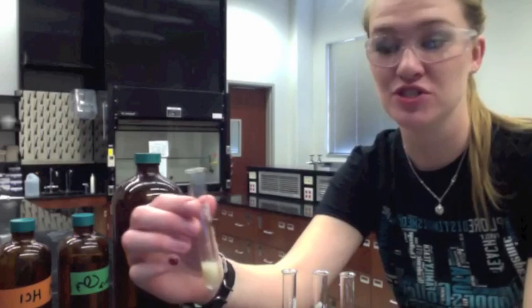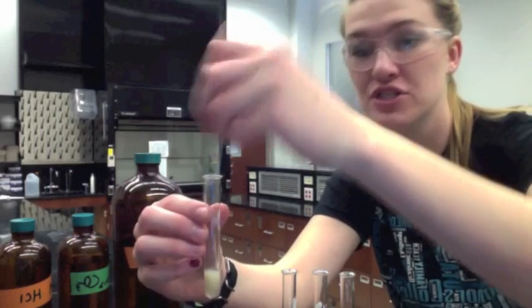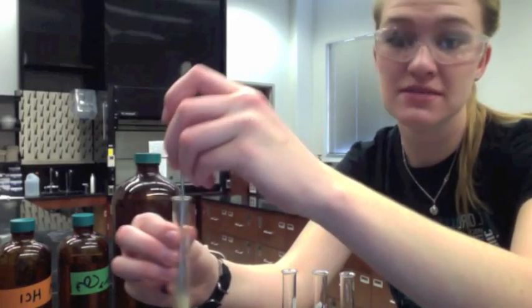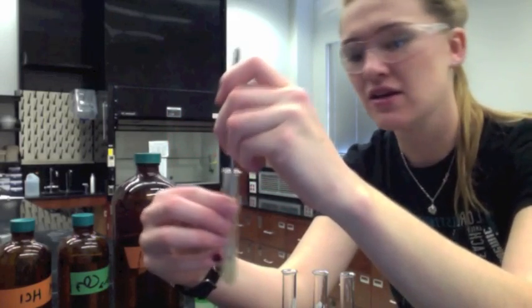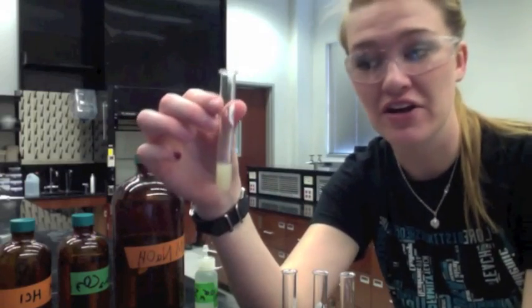Using regular water will give you false data and will make it hard to do your lab report. If, after adding your test solution, you get a cloudy substance, make sure to stir the solution. Sometimes the cloudiness will go away, which means the precipitate did not form because the solid dissolved again. However, if the substance remains cloudy, you can accurately say that a precipitate formed.